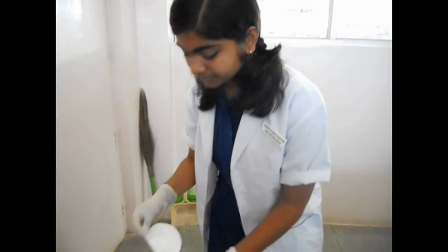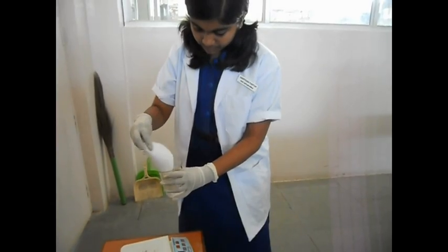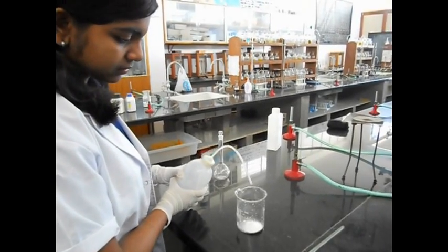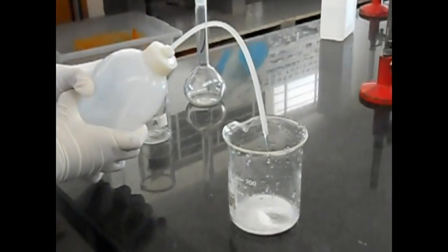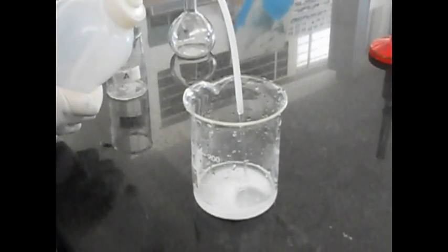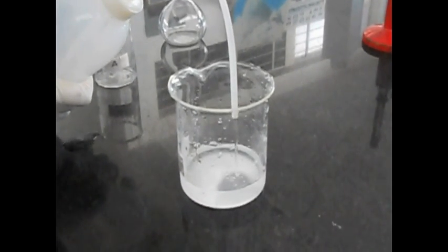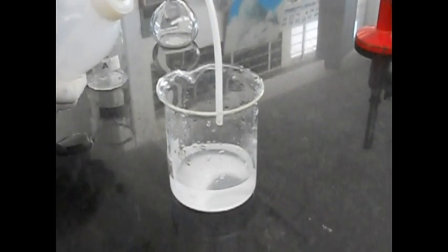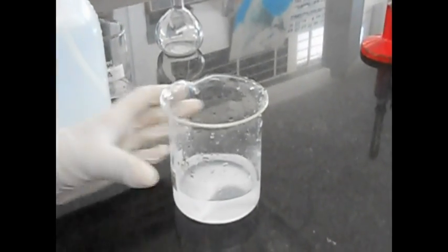Now let's dissolve this glucose in 100 ml of distilled water. I will dissolve this now.